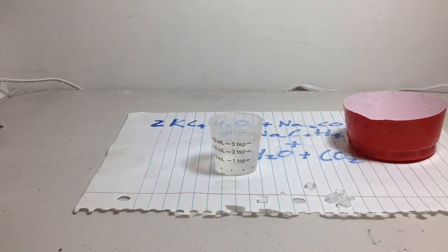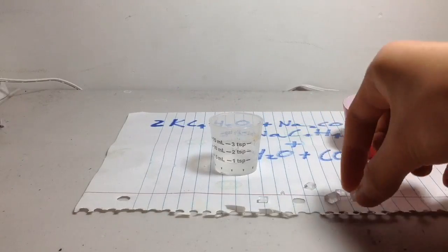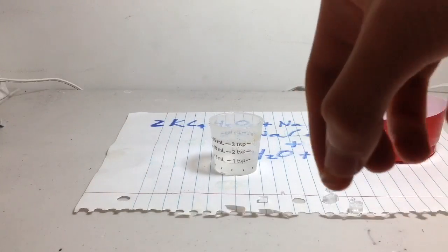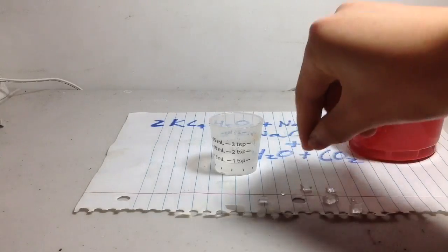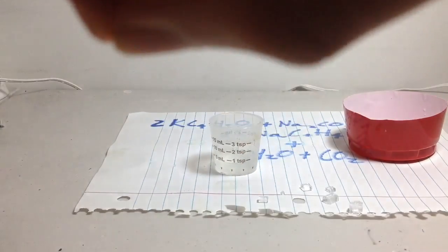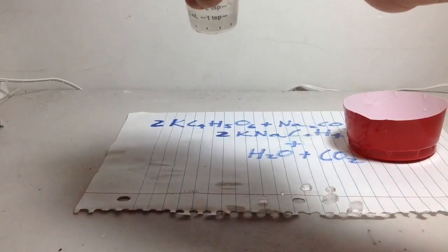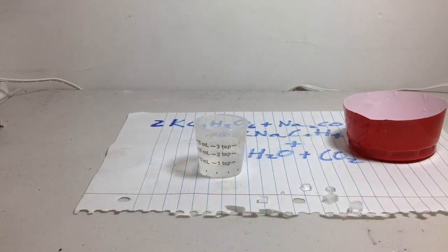We have our filtered saturated solution. Next you're going to want to choose a seed crystal to put in. You should ideally have a crystal that's not too thick and pretty wide, something like this or this one should be good, but they're too big. I'll choose a smaller one. So I'll just drop it in. Now I'll just wait for it to evaporate. When the solution evaporates, it should deposit the excess Rochelle salt onto the crystal and make it grow larger. I'll leave this overnight.